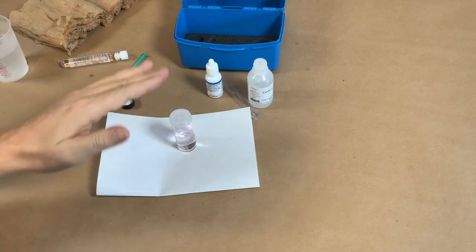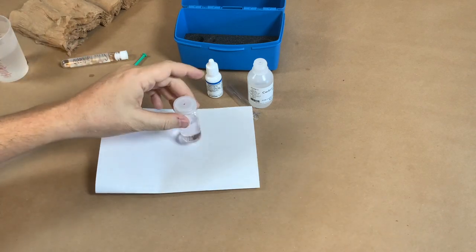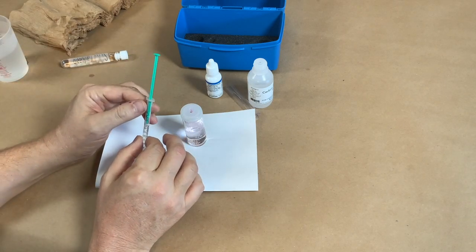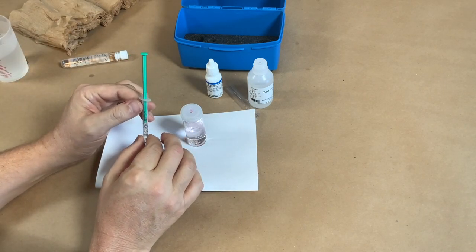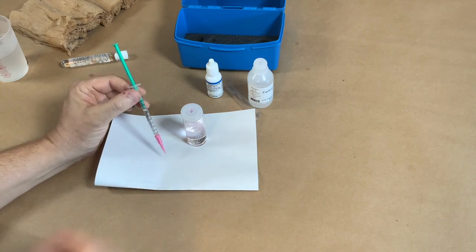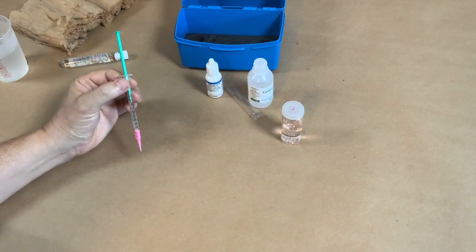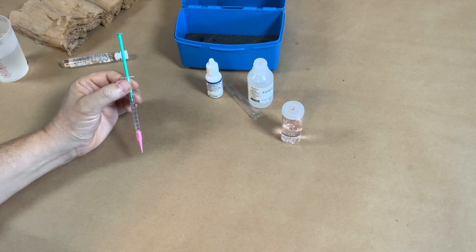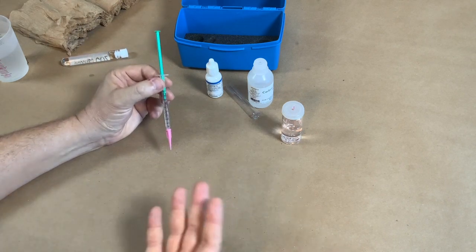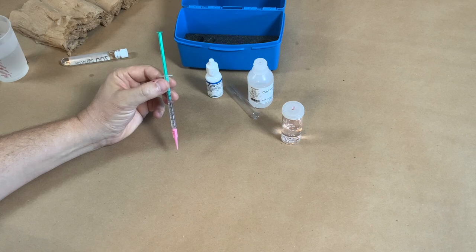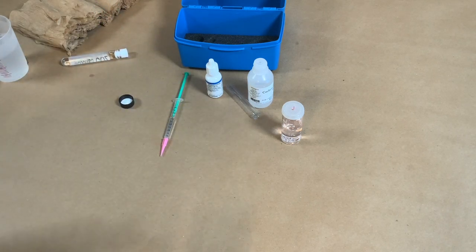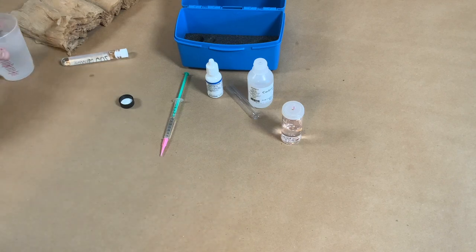So there you go. At this point I'd tell the judge, 'Hey, it's turning pink. As I shake and stir this, that pink's not going away.' So then I'm going to look at my titrator and we are at 15. So that's the number we're going to give the judge - that's 15 parts per million of carbon dioxide in here. That's what I'd report to the judge and then the judge would give me points. So this is the method for determining dissolved CO2 in our water samples.